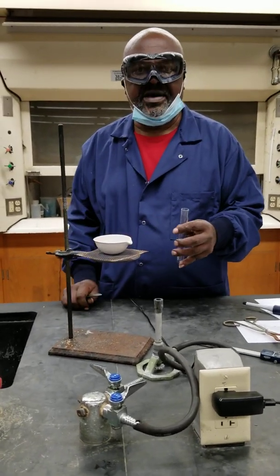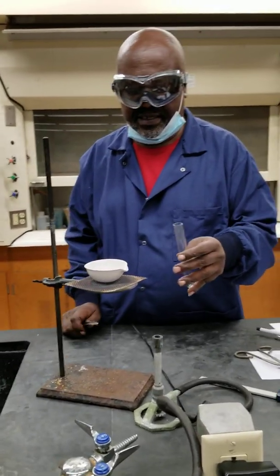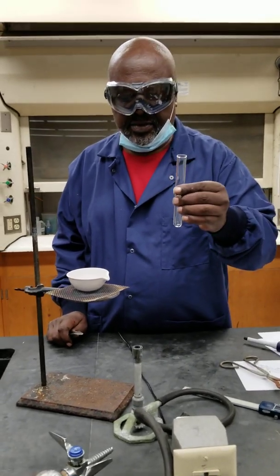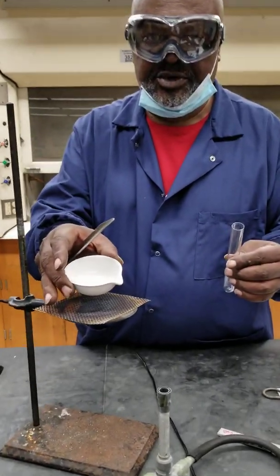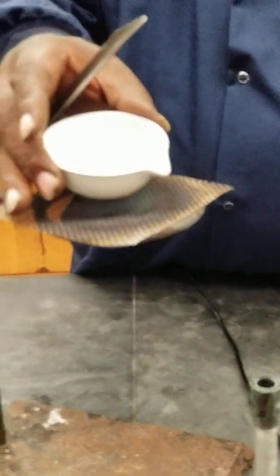All right, I'm back. Sorry we had to terminate the last video for whatever reason. Now, I have the residue here. Again, just a terminology thing.